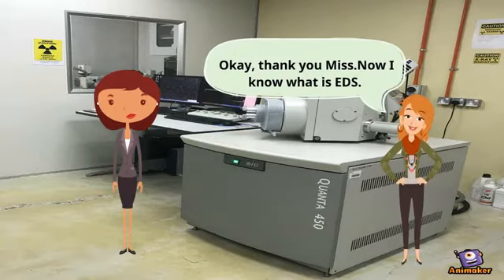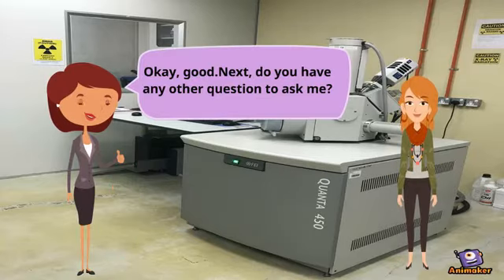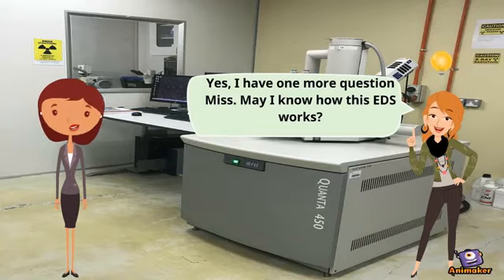Okay, thank you, Miss. Now I know what EDS is. Okay, good. Next, do you have any other questions to ask me? Yes, I have one more question, Miss. May I know how this EDS works?